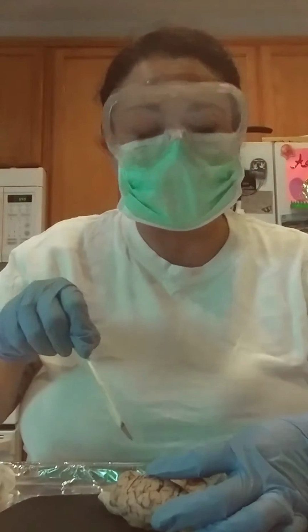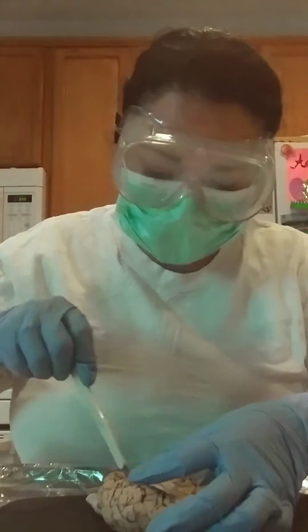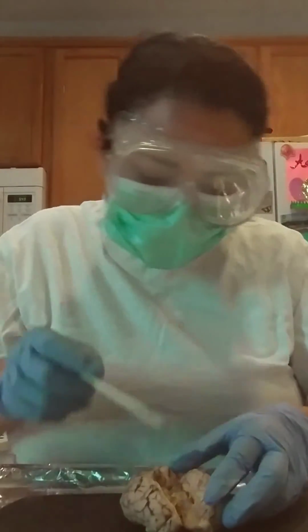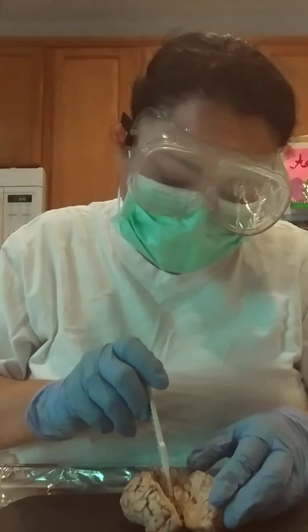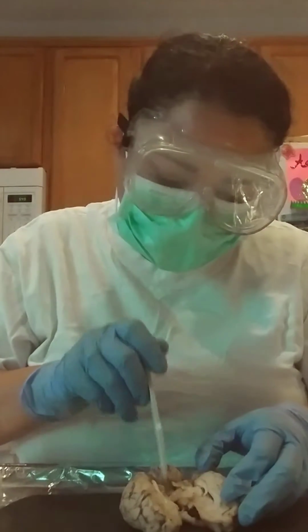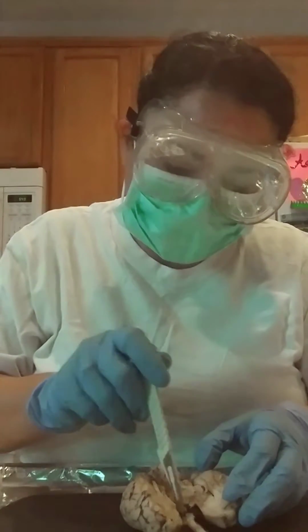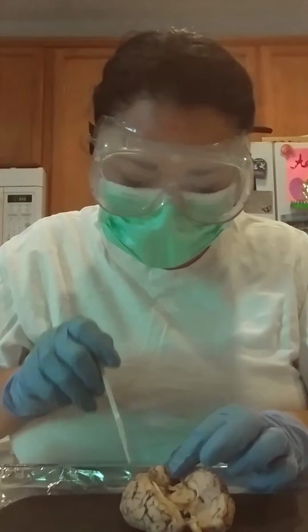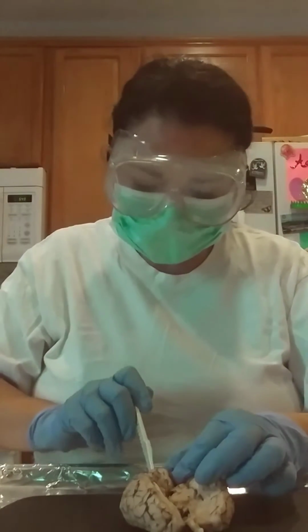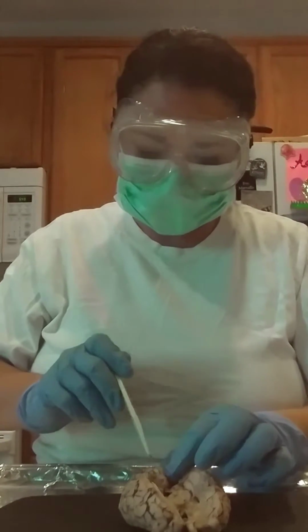I'm really loving this brain, learning about the brain, and it's really exciting for me. I don't want to... Okay, that's the eyes. And then here... Get right in the middle.